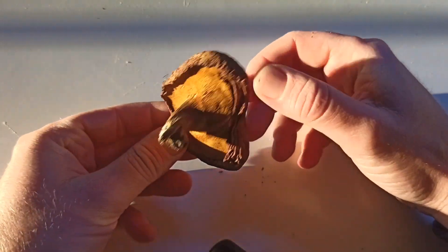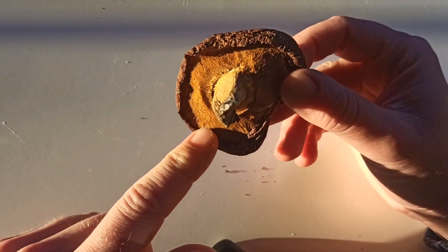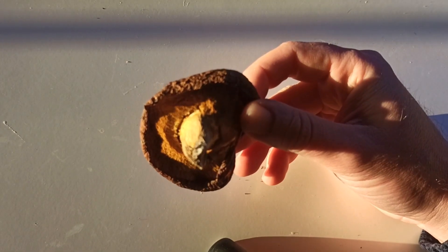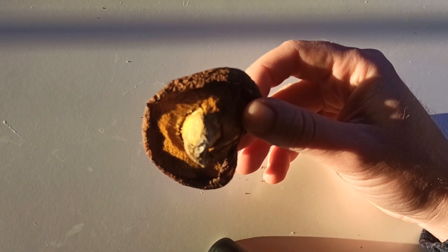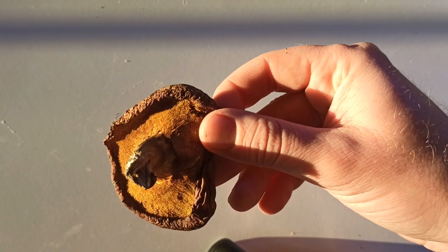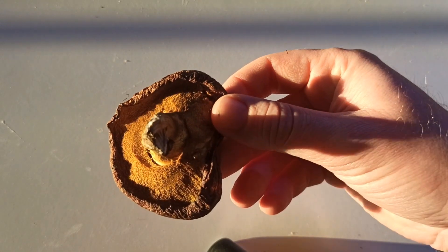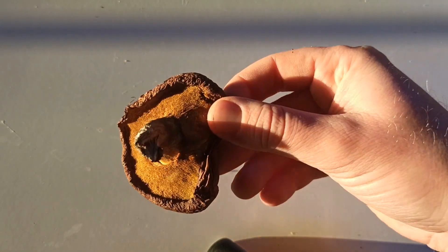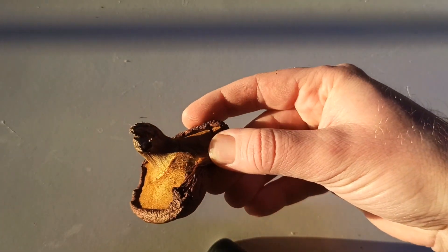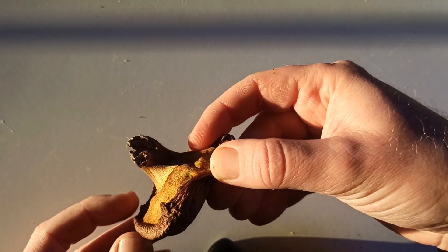What I'm going to do is see these pores. I don't know if you can see them well. I think they look good. I'm going to see how they reproduce, because they don't have gills. So I'm going to do the same thing that I did with the níscalo — the níscalo did have gills. This one I'm going to cut, I'm going to cut a piece.